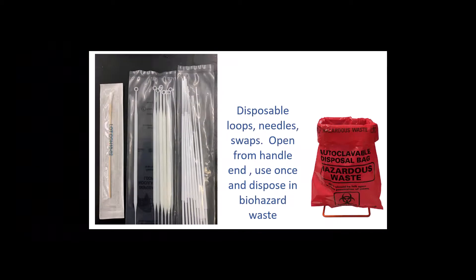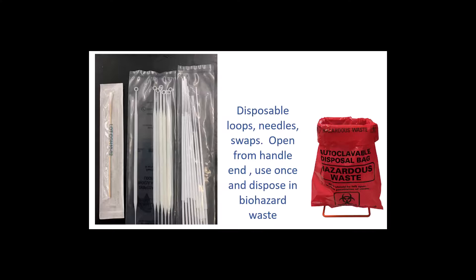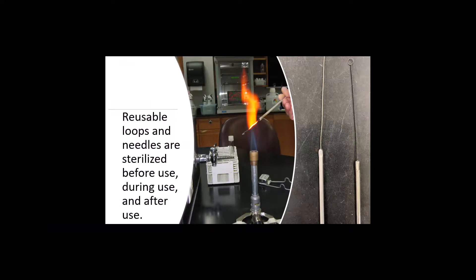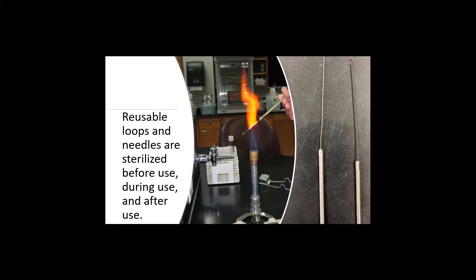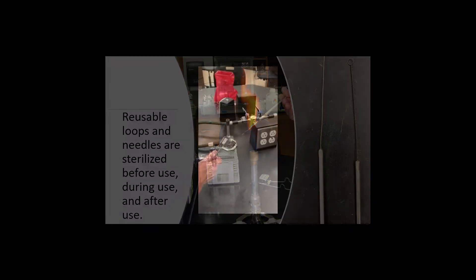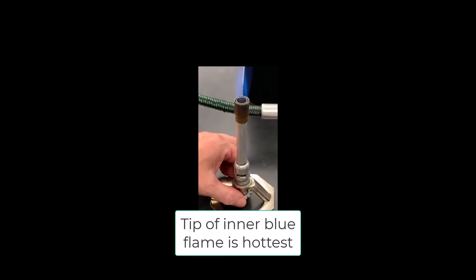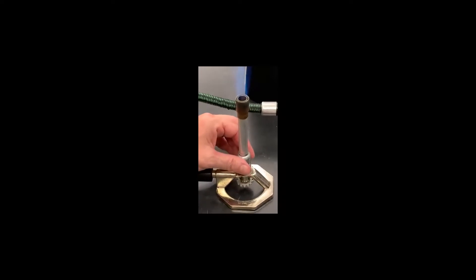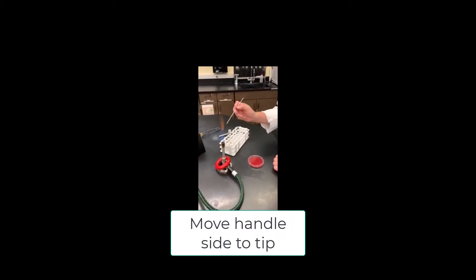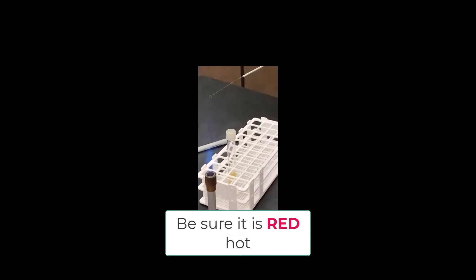Some labs use sterile disposable plastic needles or loops or sterile swabs to move bacteria between media. These are one-time use and then they're disposed of in the proper biohazard waste container. Most labs will use wire loops or needles, which need to be sterilized before, during, and after use. Many labs will use a Bunsen burner for that purpose. Be sure to adjust your Bunsen burner so that there's a nice inner blue cone of flame — the tip of that cone is the hottest part of the flame, and that's typically where you'll work to use your time most efficiently. Start by heating the wire near the handle and then move towards the tip. Be sure it's red hot. The reason the loop or needle is moved from the end towards the tip is to prevent dispersing bacteria into the air.